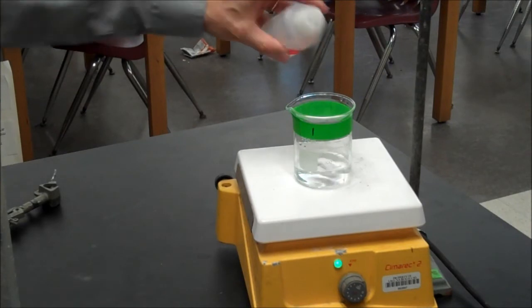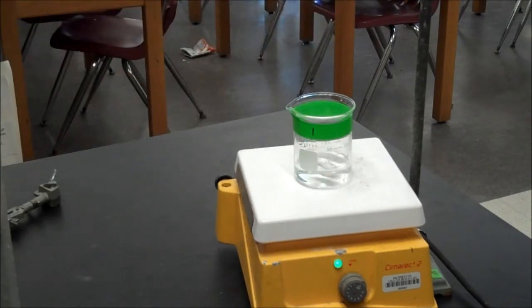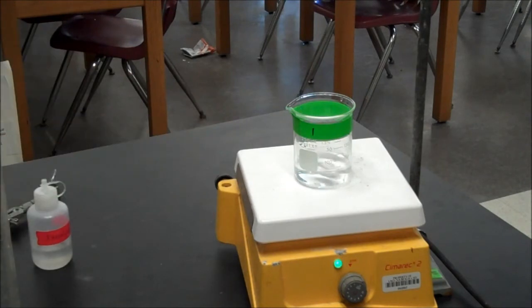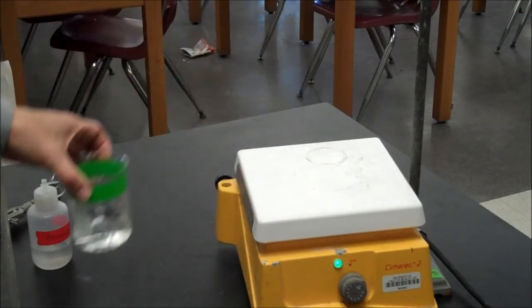So one, two drops. I'm not expecting any color change here because I don't have any bases in the beaker, only the acids. I'm now removing the beaker, setting it aside.